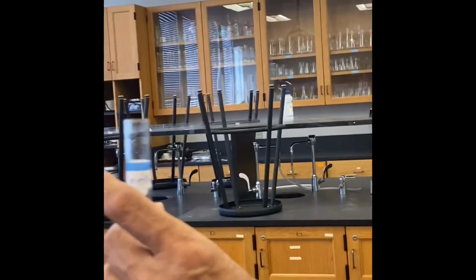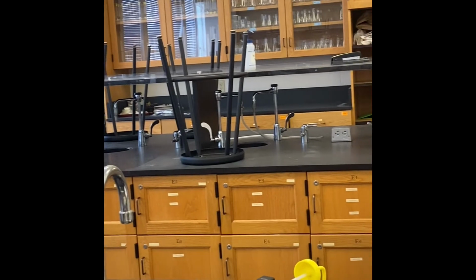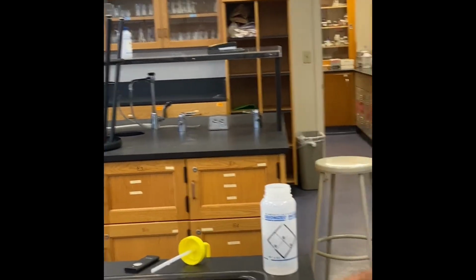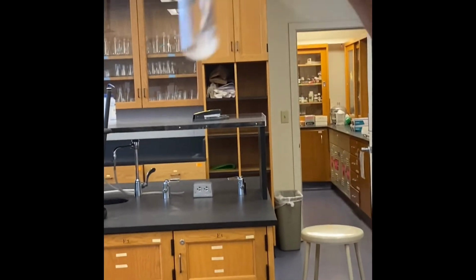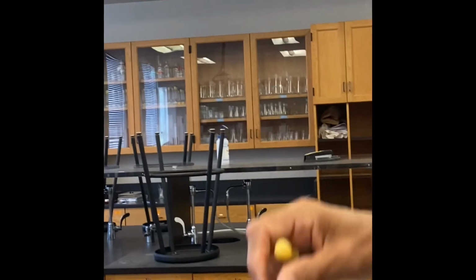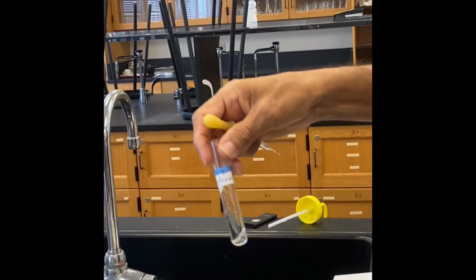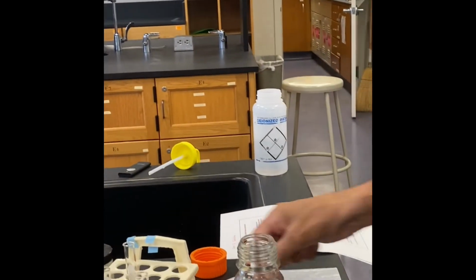Second one is methanol. Where is methanol? Methanol is here. I'm going to add 1 ml of methanol, right? Again, can you see here? It doesn't dissolve, but there is a little bit, it looks like. You have to compare to the reference compound. You can still see something undissolved here. Maybe a very little solubility. So for number 2, again, I have to change the pipette to a new one.